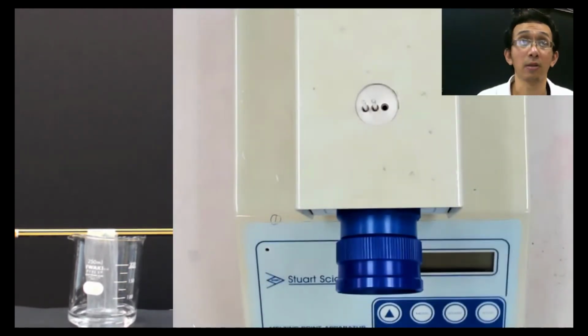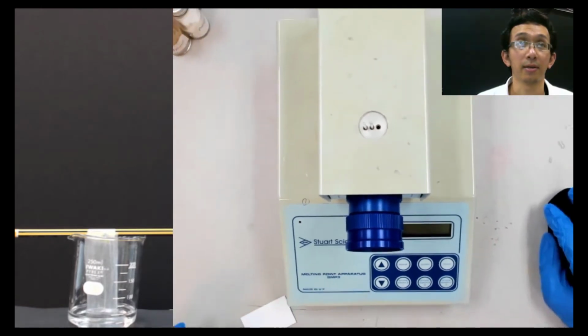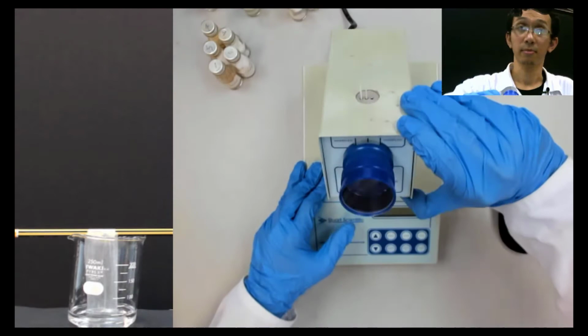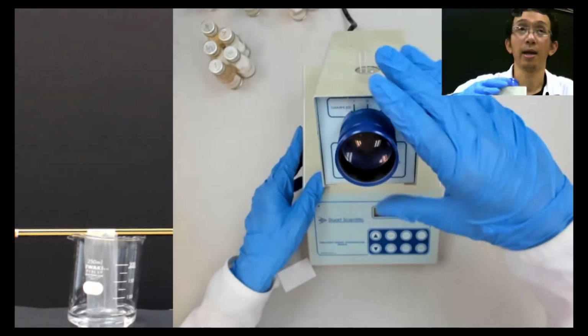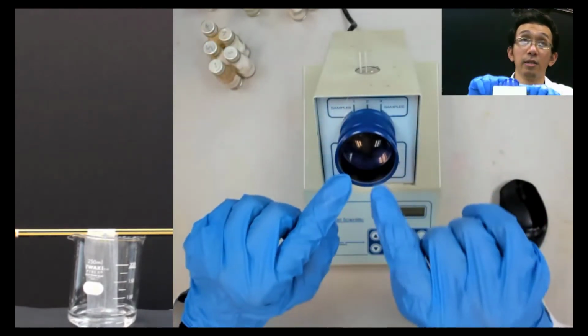Okay, for this I need to zoom out. There are a lot of controls. Okay, zoom out in detail. So I do it like this. The detail you can see in the melting point live stream, but I need to change the camera here. So the camera on top of this, I need to change so that you can see here.